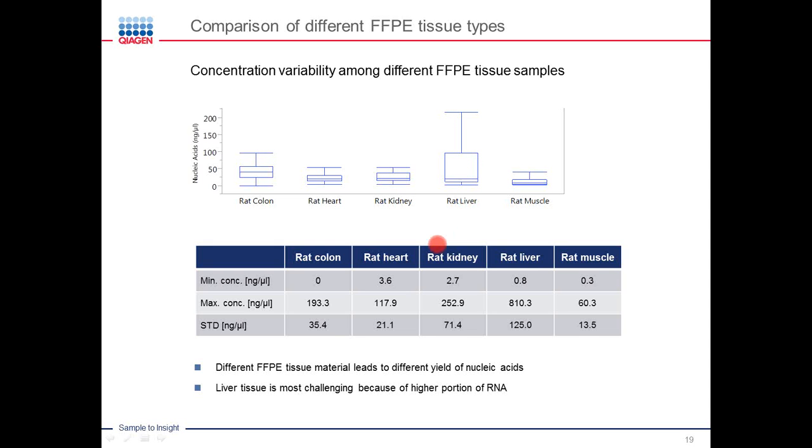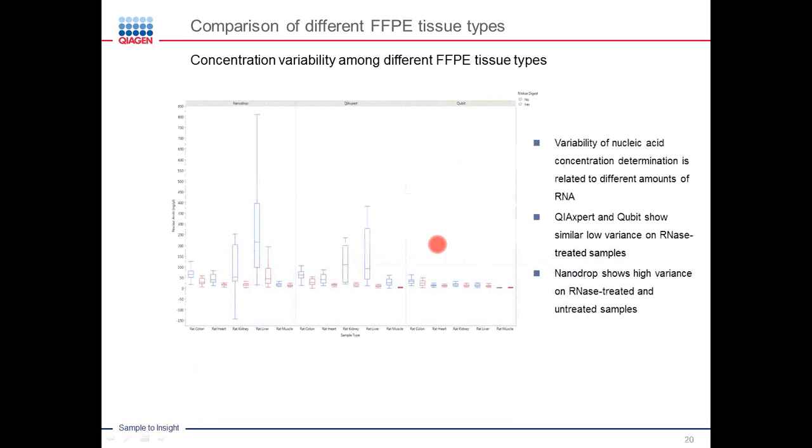So you may then say, okay, what about RNase versus non-RNase treatment in the different tissue types? We also looked at that, and it becomes very obvious when you look at these box plots here that again the majority of the variation on the absorbance-based measurements comes from measuring additional RNA, which is still in the samples. However, if you look at the red data points, and this is very obvious here with rat liver, when measuring those samples, even those that were treated with RNase, so no RNA in there, a higher level of variability was still seen on the nanodrop, versus, for example, this data point on the QIAxpert versus the qubit system.